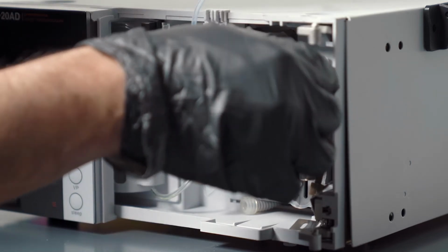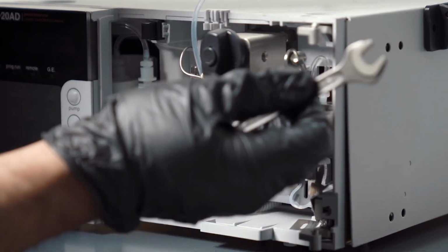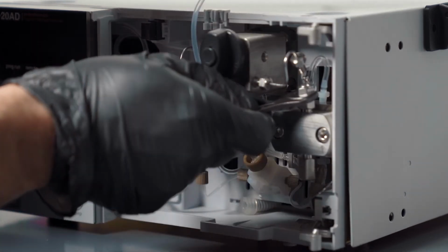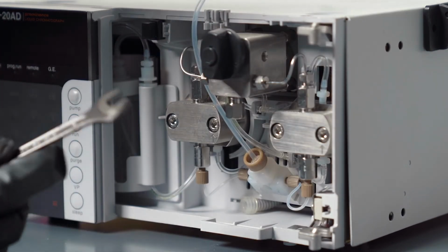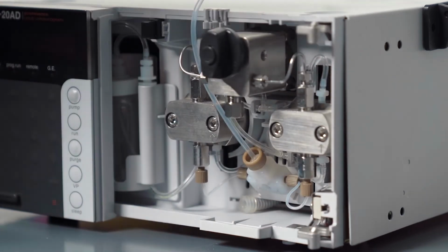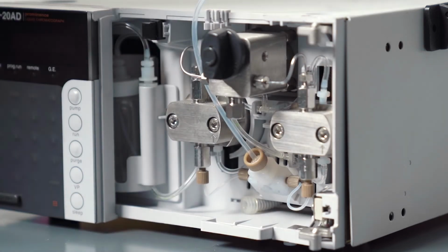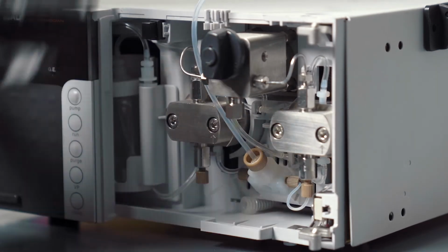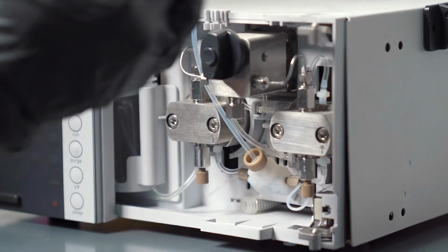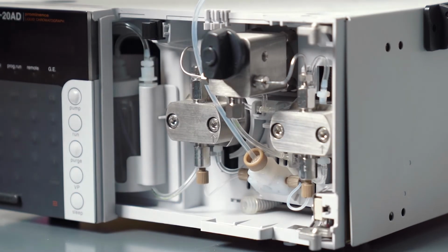You want to be careful not to mix up your inlet and outlet check valves. Pay attention, otherwise you'll have a bad time because no solvent's going to be going through. All right, so let's tighten that guy. So that looks good. This guy goes in now. Okay, and then you just want to snug these up. And then what you can do is start passing some solvents through here and make sure it comes out of here before you hook it up to the rest of the HPLC, just to make sure your solvent is flowing properly. It's better to do that than to just plumb the whole system and start. It's always a good idea when you check new parts to make sure that module is working well. So pass solvents through here, make sure it comes out of the pump okay, and then cinch everything back up and plumb everything in line with the system.